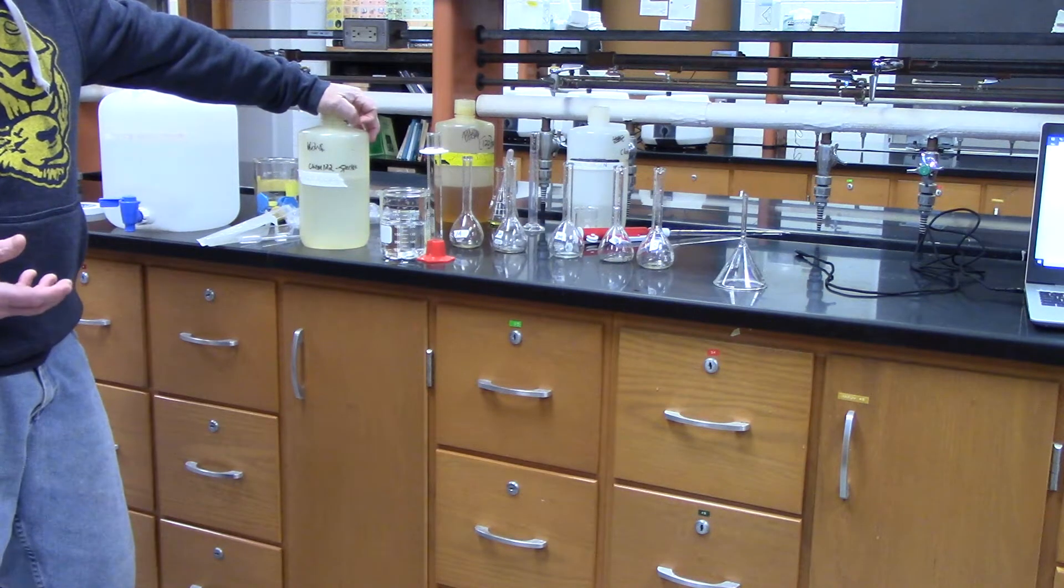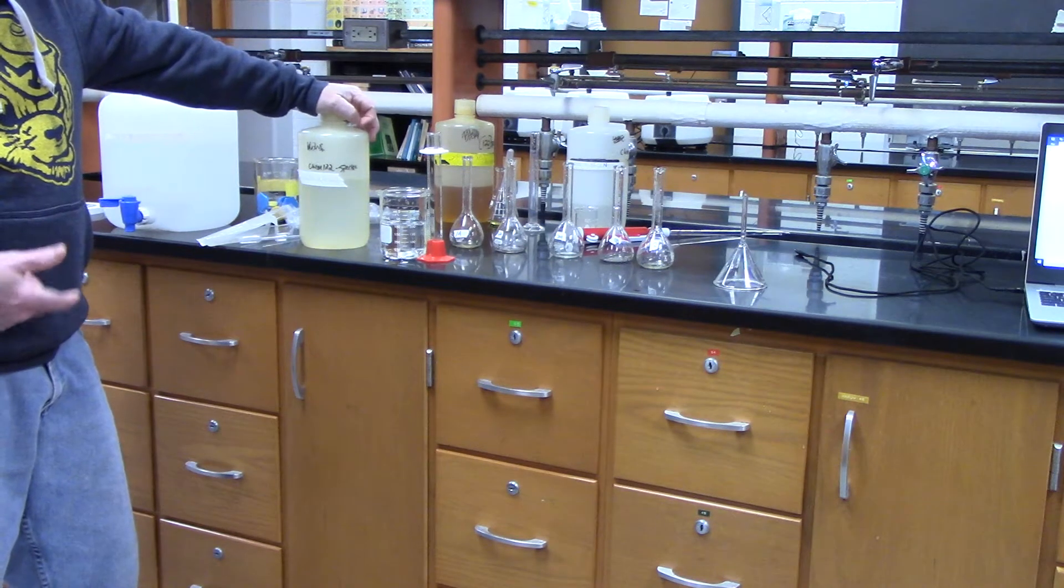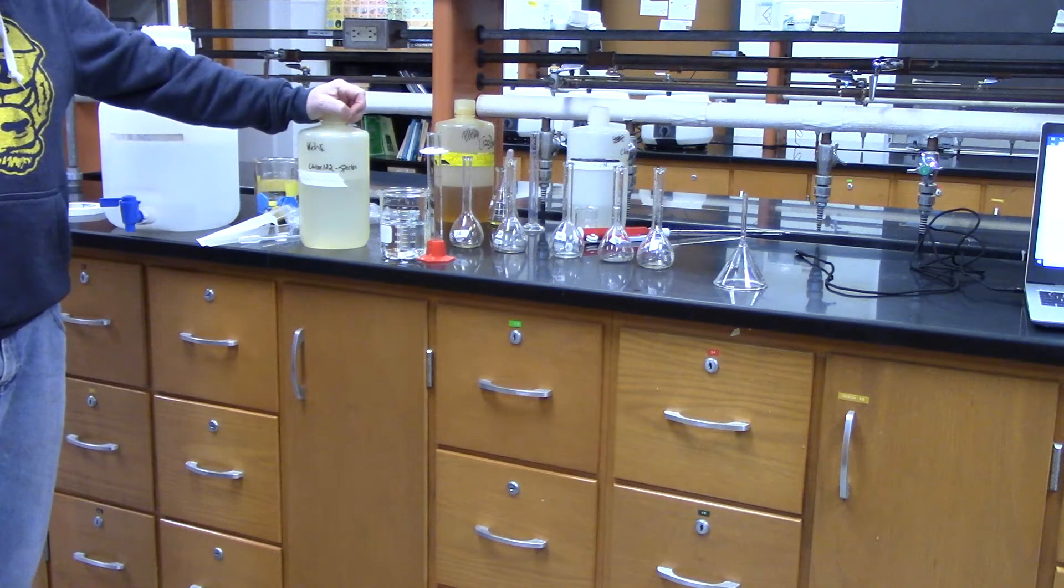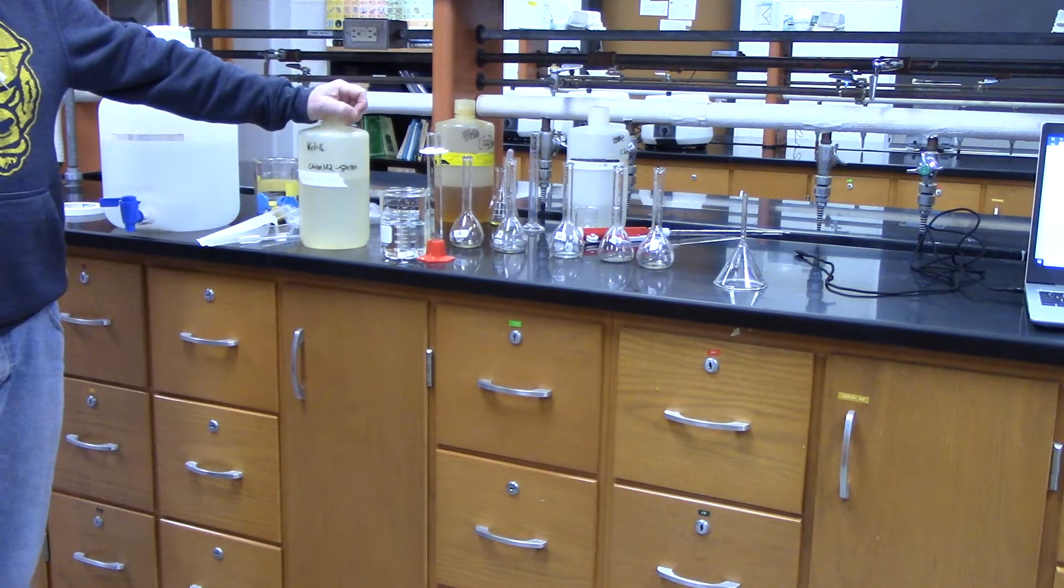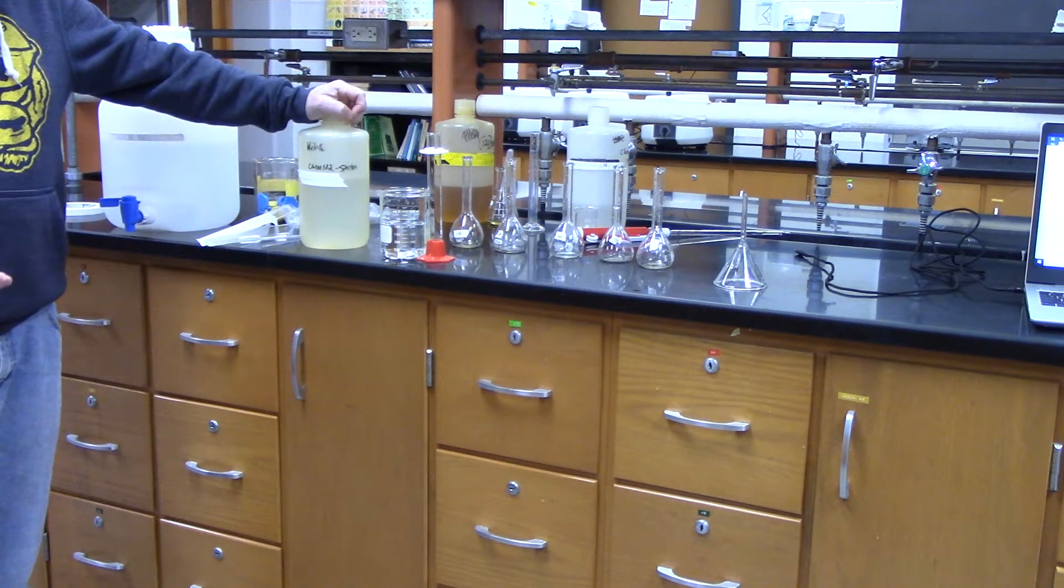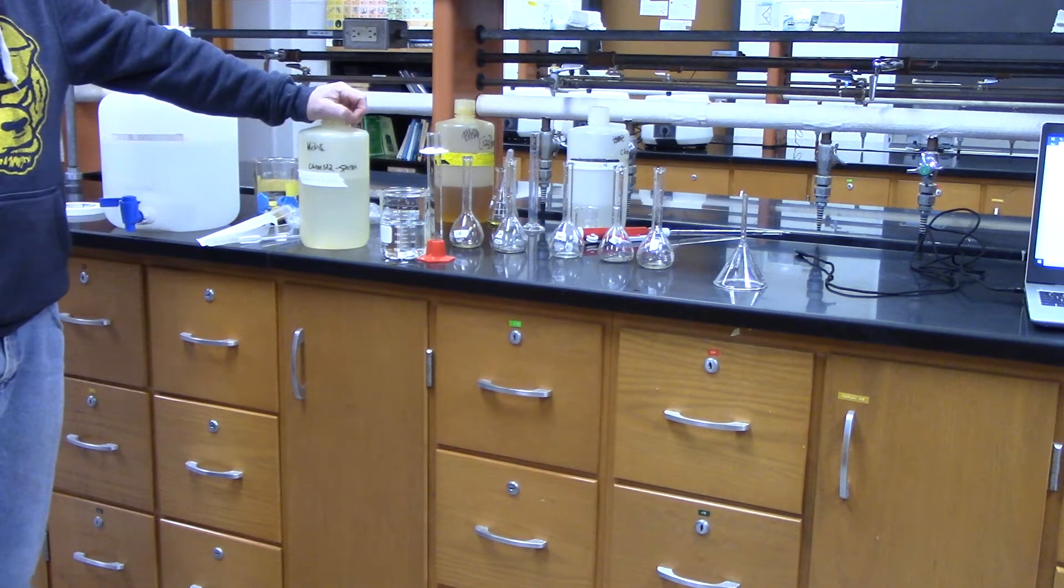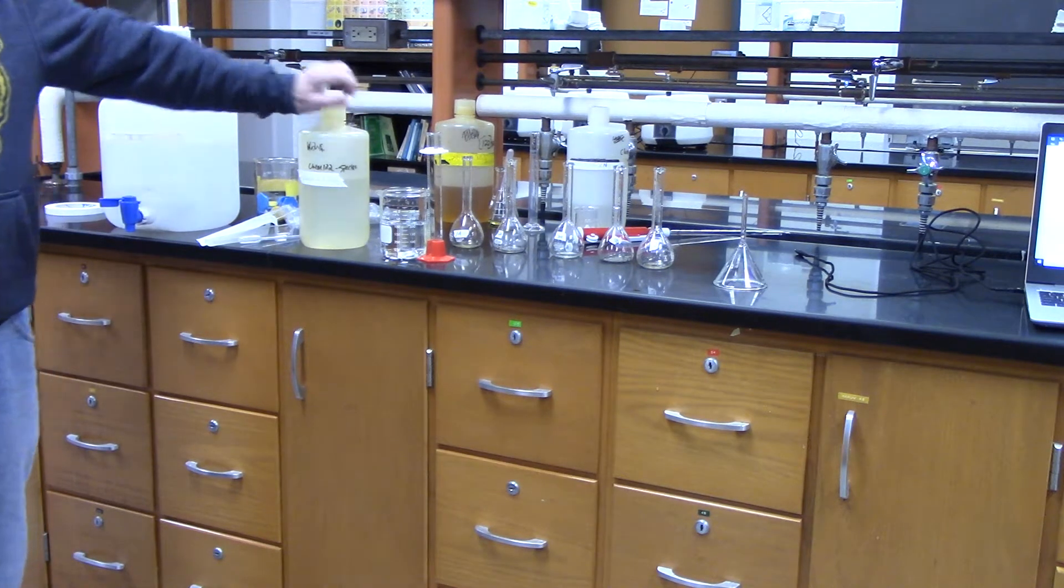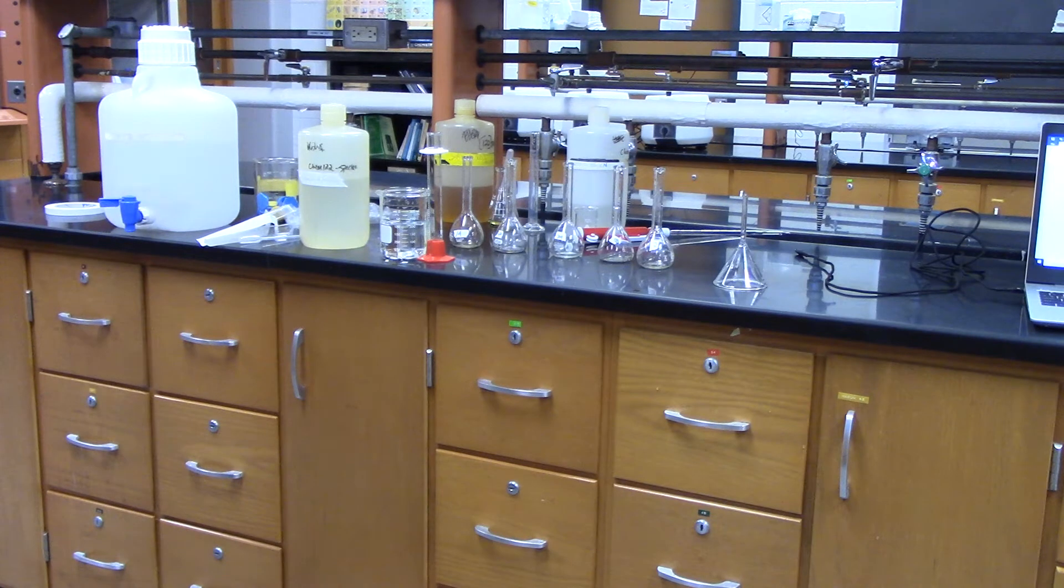Hopefully we'll see trends as we do the experiment that suggests we're doing it right. I think we may have done the first experiment right because as the increase in concentration from 1A to 5A, the absorbance got higher. So this part, I'm going to make up five other solutions.